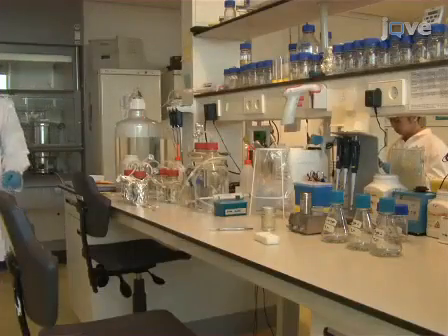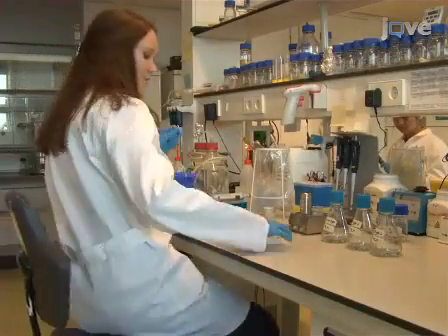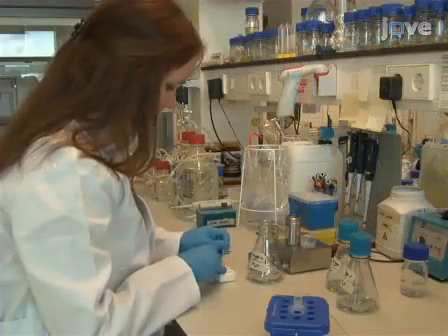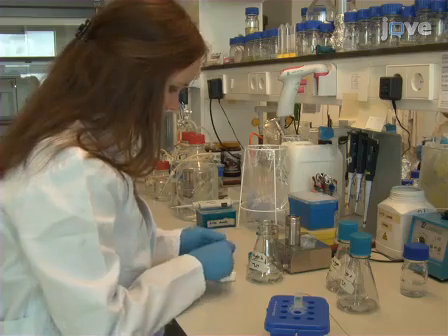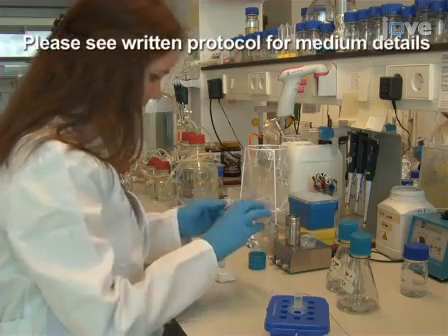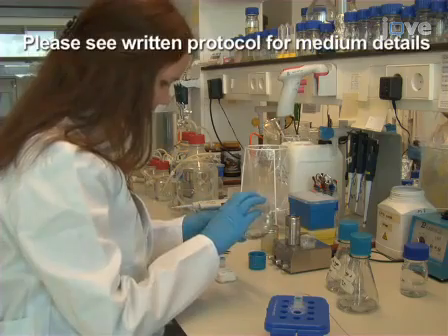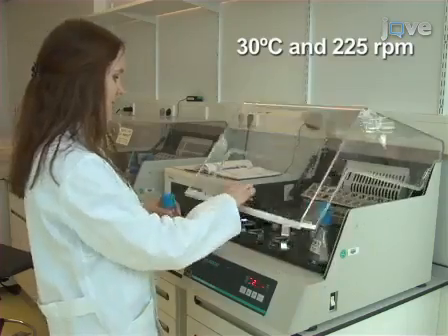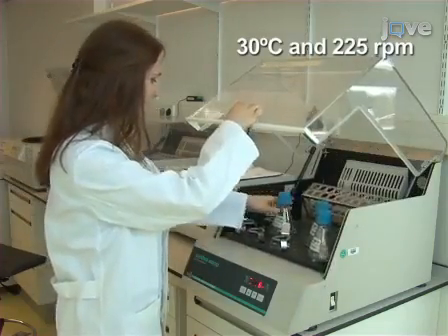To prepare B. subtilis, inoculate cells from -80°C stocks in 10 ml of time-lapse microscopy, or TLM, medium in sterile shake flasks, supplemented with antibiotics if necessary. Grow the cells overnight at 30°C and 225 rpm in a sterile shake flask.